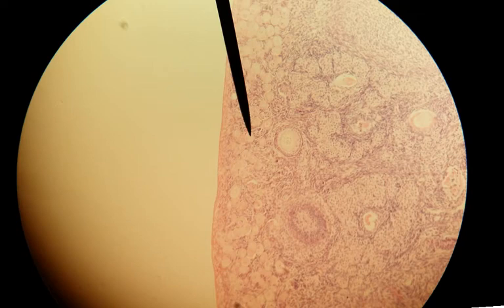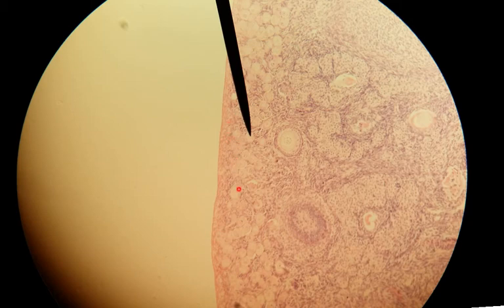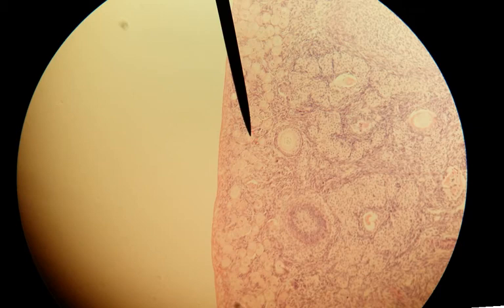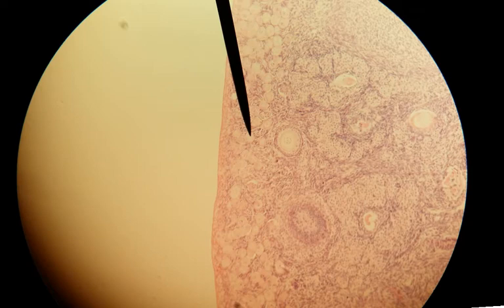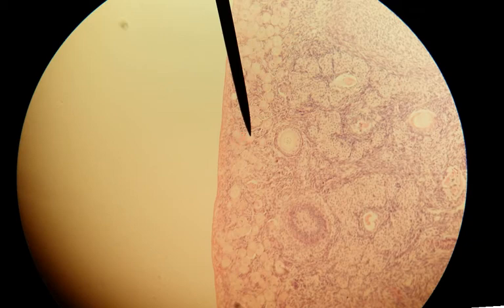These underdeveloped eggs are called primordial follicles, and they tend to cluster around the edge of the ovary. If we look really closely, there doesn't appear to be any border — no cells that form the rim around them. That will make more sense when we compare them to the other developing stages. So: clustered together around the edge of the ovary, with no noticeable cells around the edge — that's a primordial follicle.